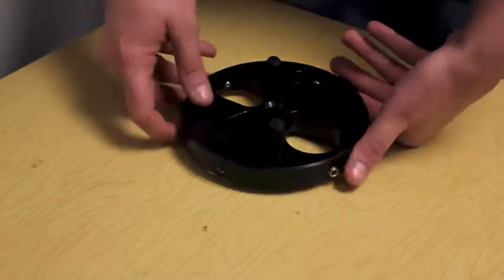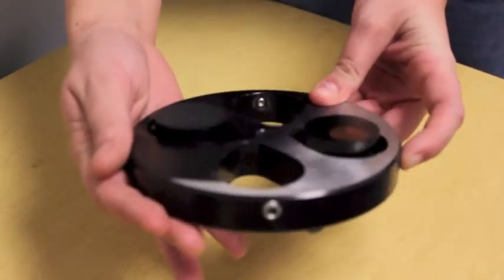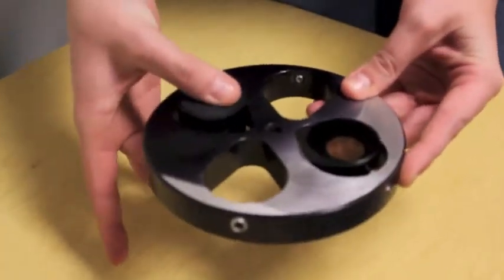Once the screws are tightened, you will want to visually check that the samples are protruding the same distance and are secured into place.